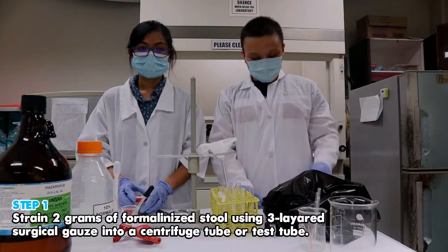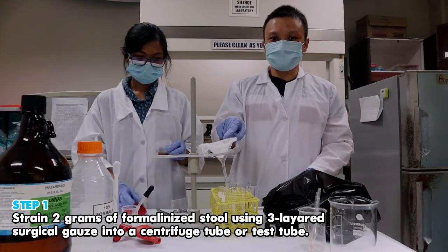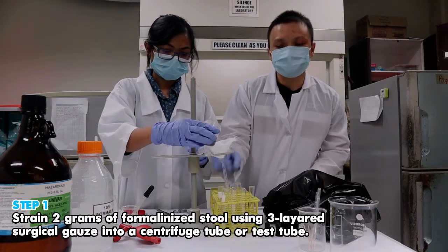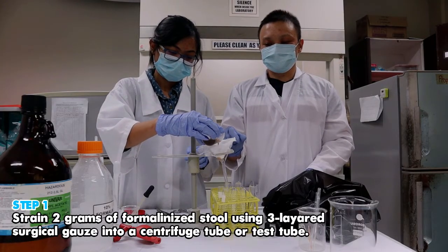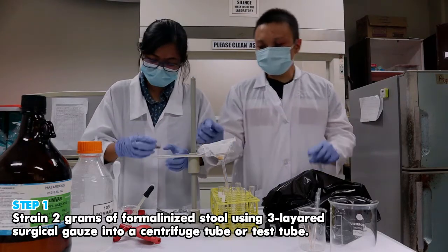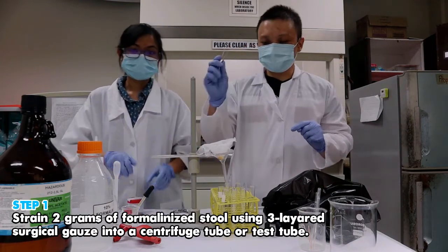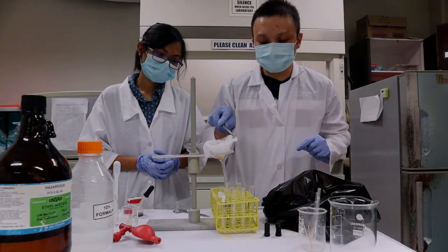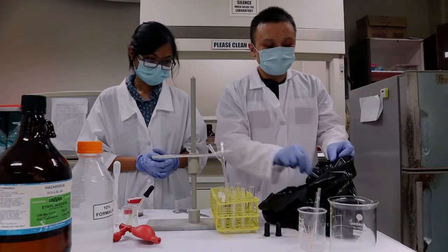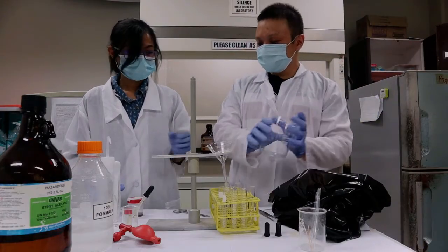So, step 1, we would strain the fecal solution into the 3-layered gauze, pouring into the test tube that we will assign for the solution. Okay, so as you note, the solid parts are filtered into the gauze. So that's what the forceps are for. We need to remove it immediately after filtration so that we will not contaminate the area into a biological hazard bag. So we will now get the beaker assigned for decantation.